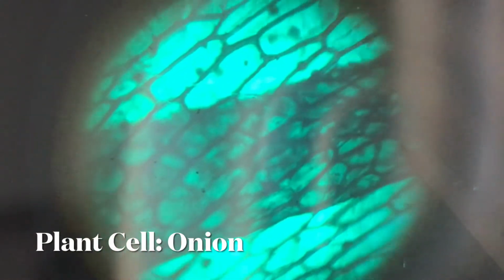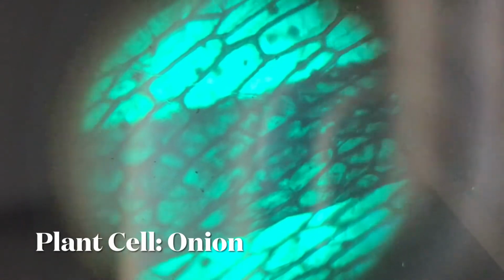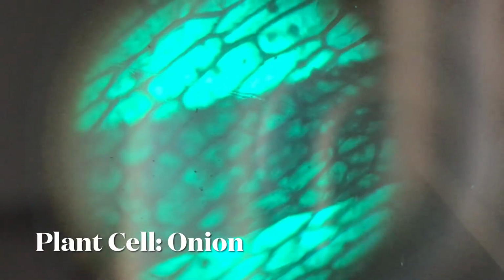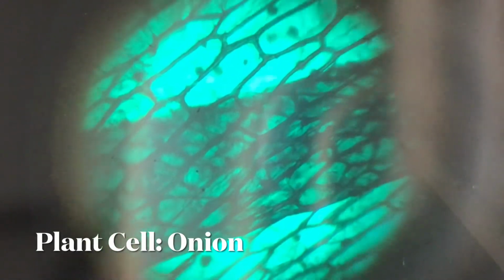The viewing may still be a bit blurry, so you just use the fine focus knob to get a more focused image. That's when you can observe that the cells of the onion are definitely plant cells, because you can see the regular shape and you can even see some of the nucleus of the onion cell here.